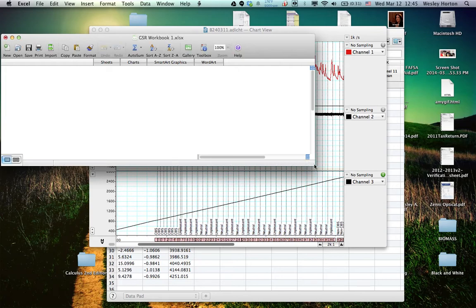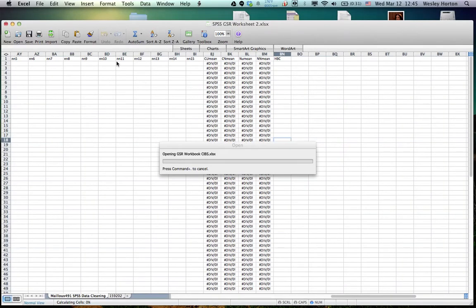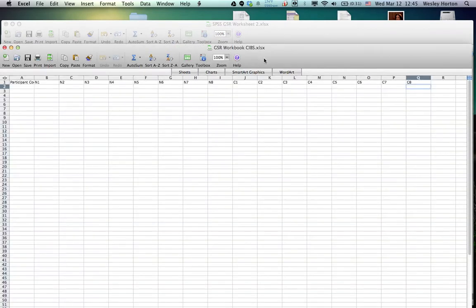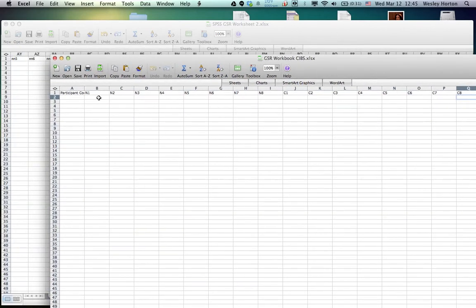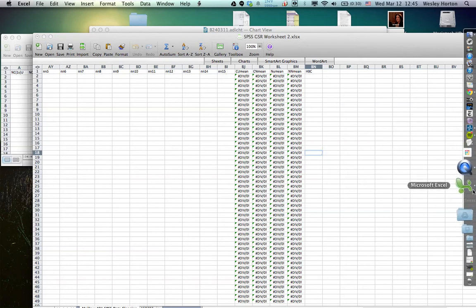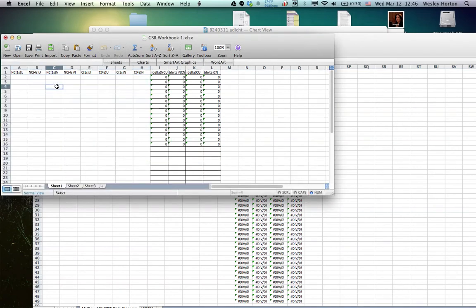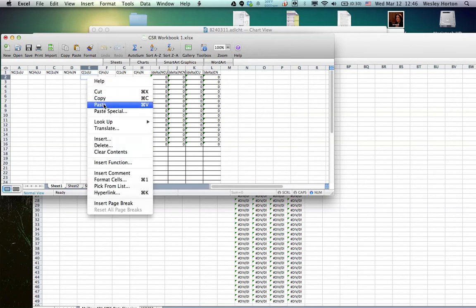All right, there it goes. All right. Here we go. All right. So the first one is going to be our sibs and unpleasant, and it was the 1 second mean before. Paste that there.